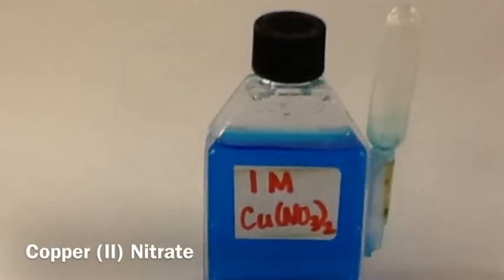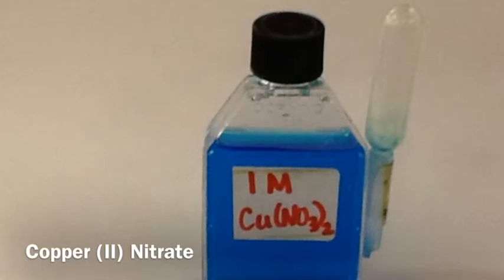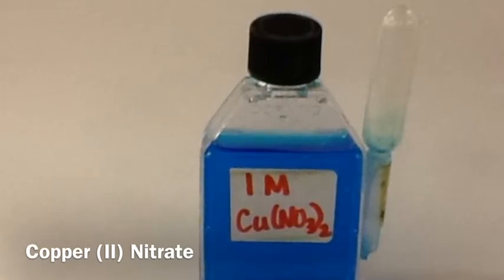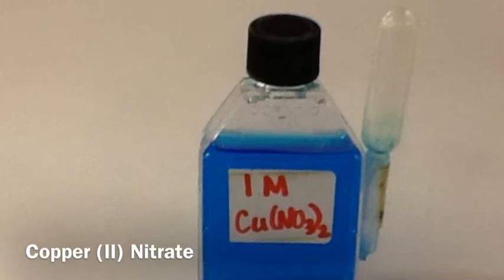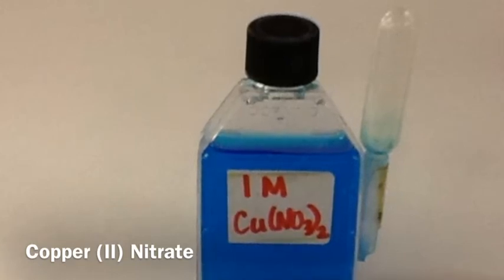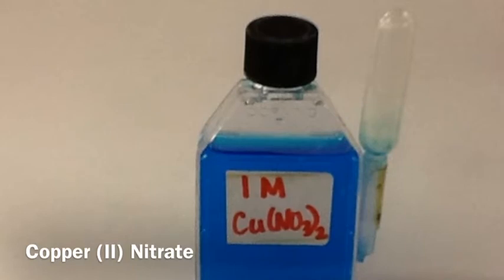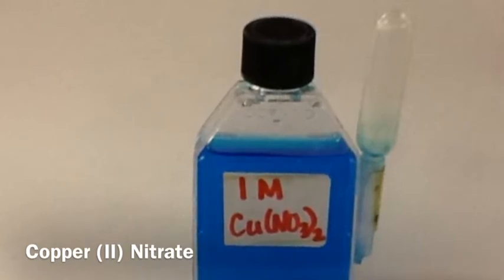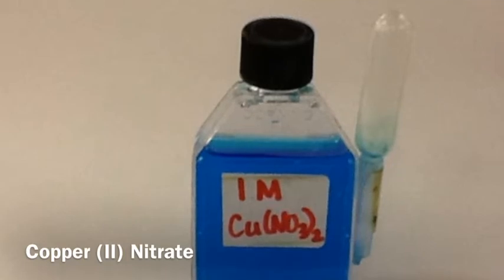The first chemical is 1 molar copper 2 nitrate. The 1 molar, or 1M, stands for the concentration. In this case, 1 mole of copper 2 nitrate was dissolved to make 1 liter of solution. For each one of these chemicals, make sure that you record at least 2 things.